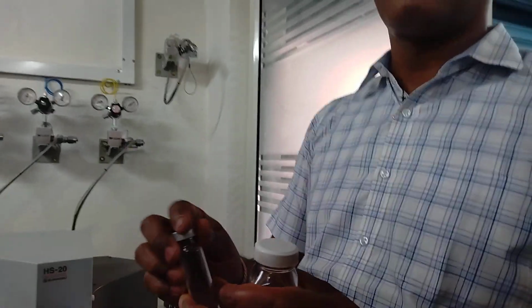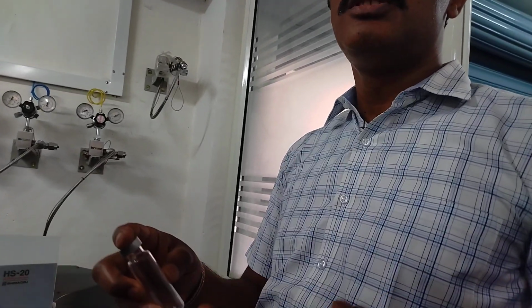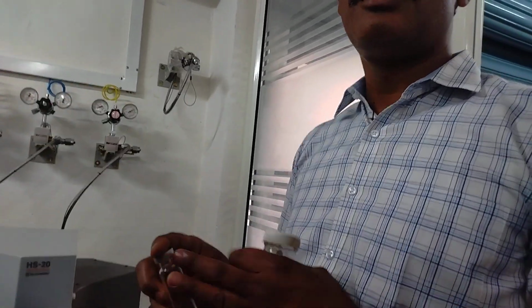Okay, sir. But the environment, say air, what does it contain, oxygen, nitrogen, even CO2, if it is there, that cannot be analyzed in FID. FID cannot detect these three gases.